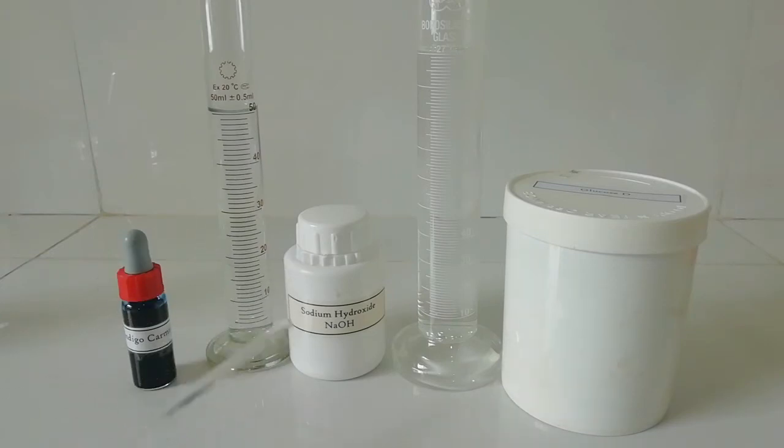The first solution is sodium hydroxide solution. For that I dissolved one gram of sodium hydroxide in 50 milliliters of distilled water.